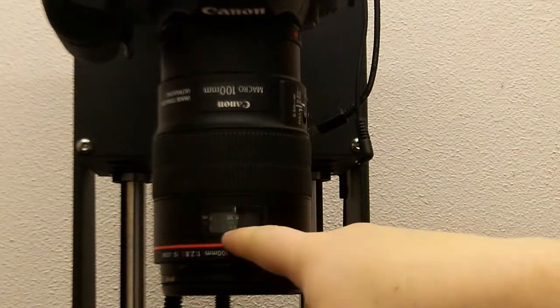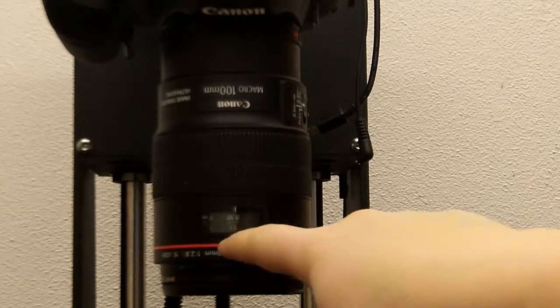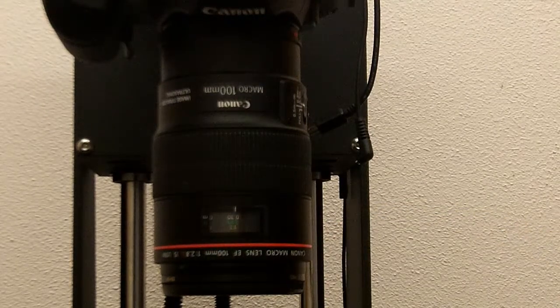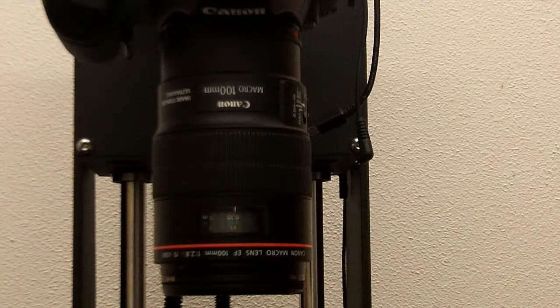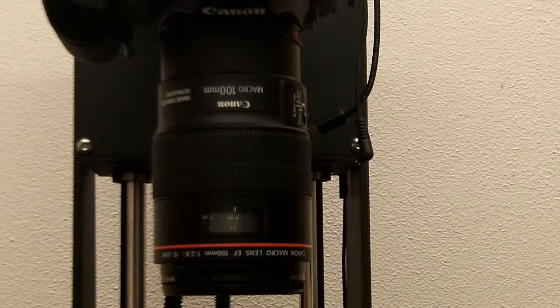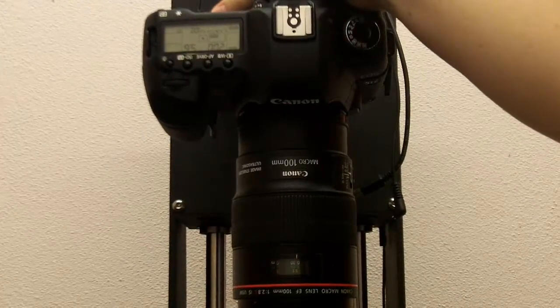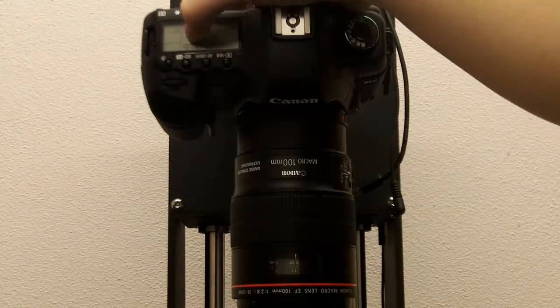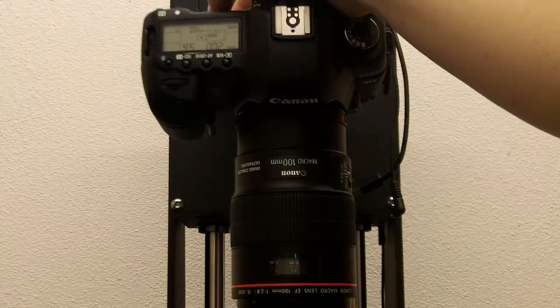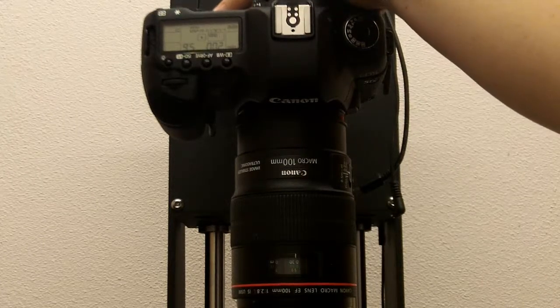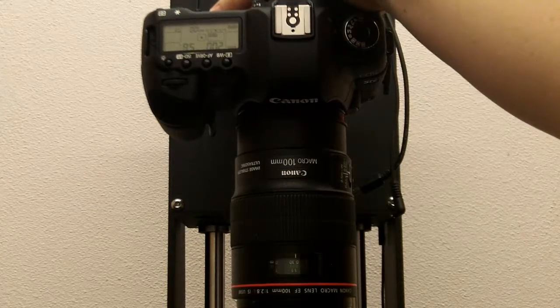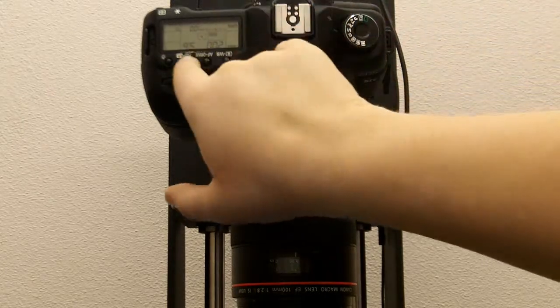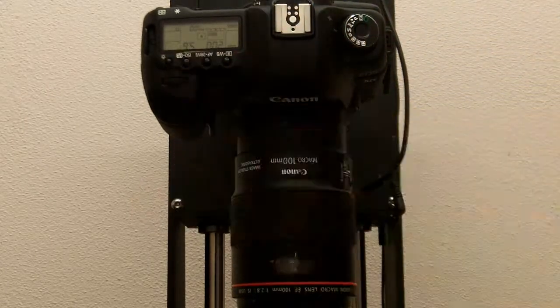And you can see on the lens, it is the yellow text that's in ratio format, which will let you know what the magnification is. As an aside, you can change the aperture for the camera by turning this dial on the top, and you can see it change right here.